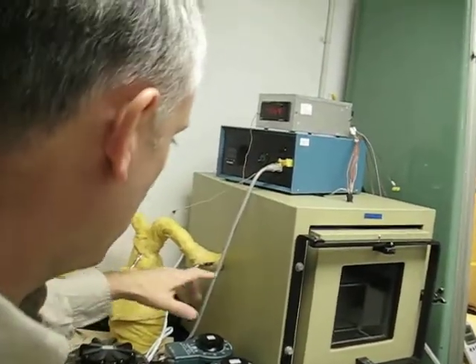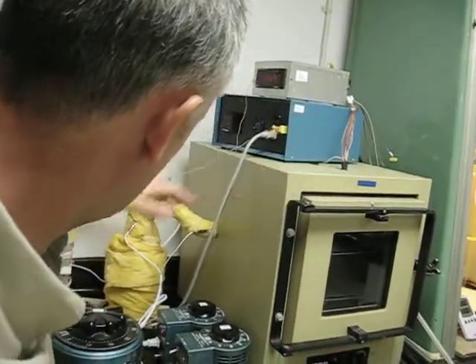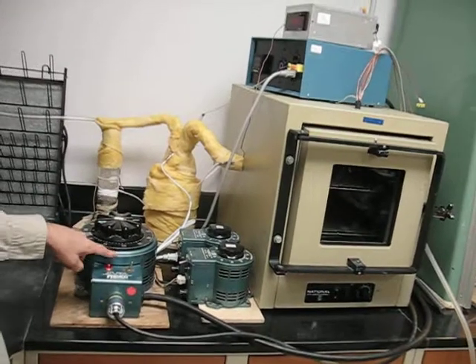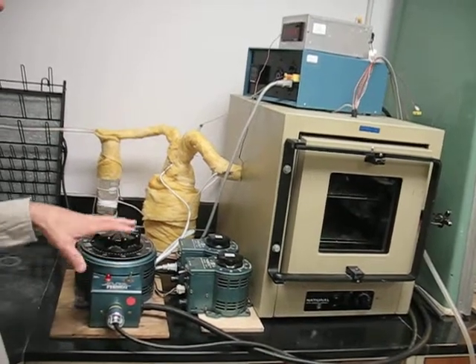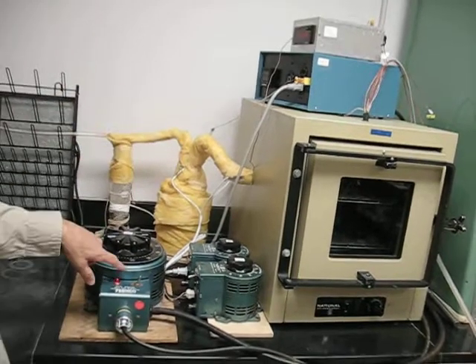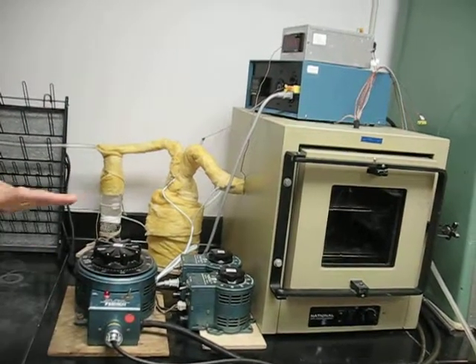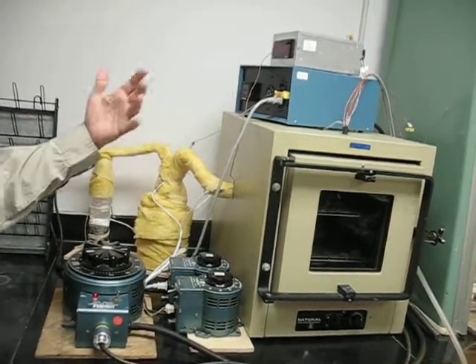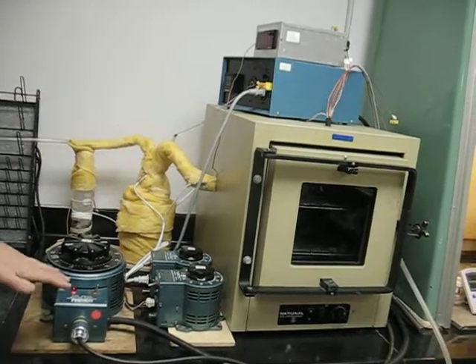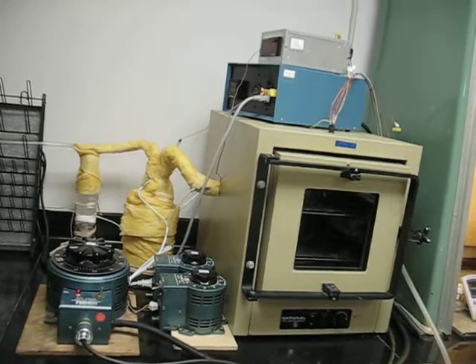And actually, the temperature of the oven is not a temperature feedback, correct? Right. It is a voltage that has been determined empirically under these conditions that we set on this variac, and we've observed that it maintains this 4 degree C span at this setting, at these conditions.